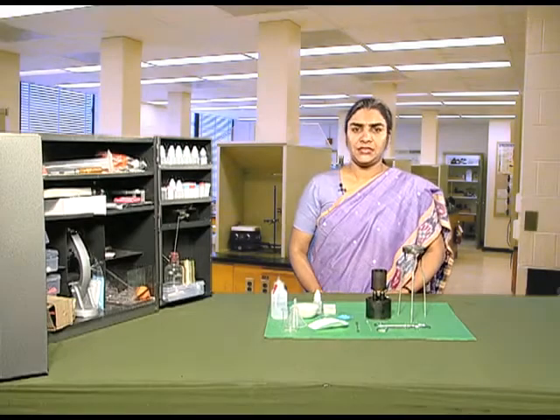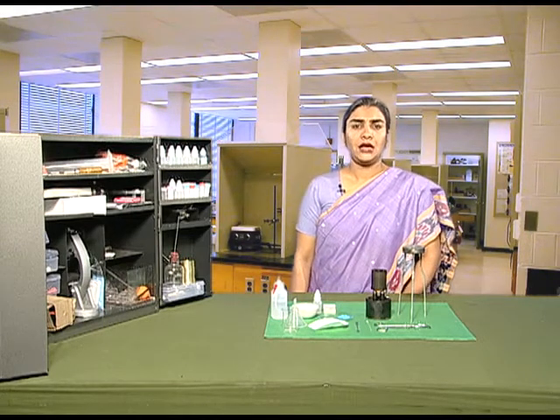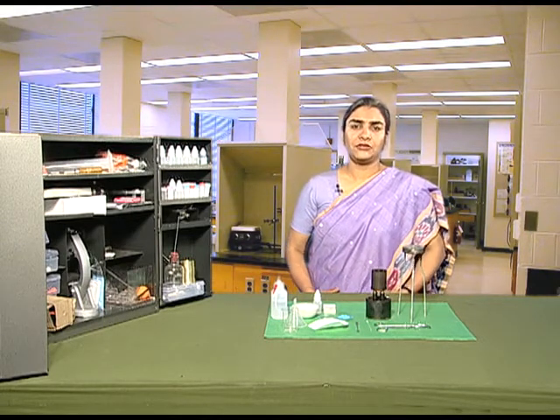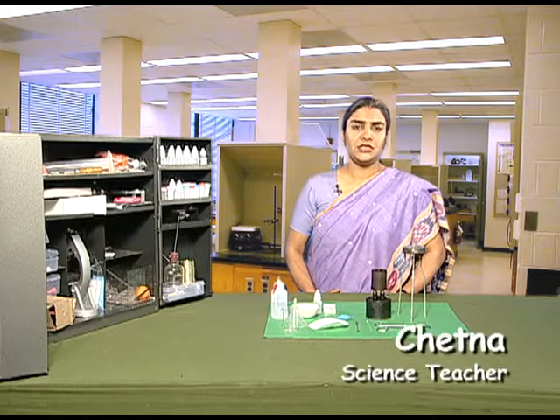In this activity, we will learn how to obtain crystals of copper sulphate from its solution.